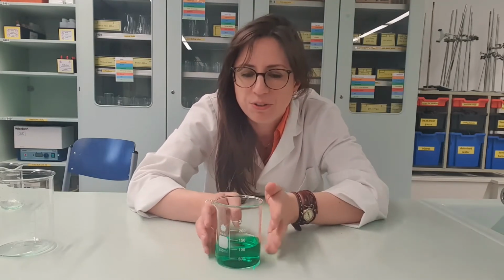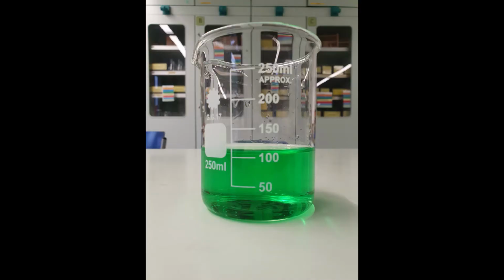Take a look for yourself. Not quite the same as it was before. The smaller beaker does not agree with the larger beaker. It's actually saying that the original volume is more than 100 milliliters.